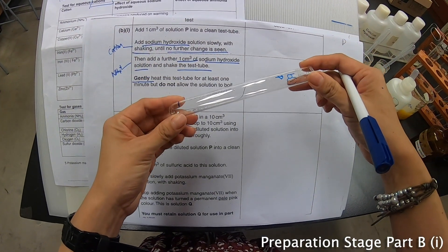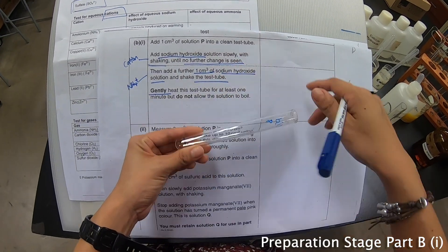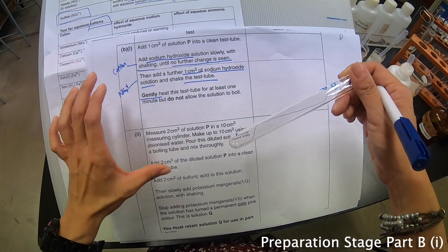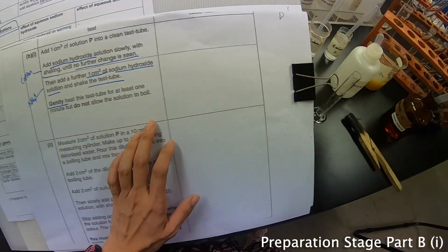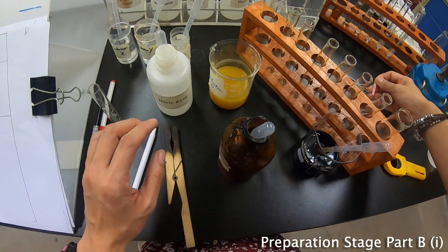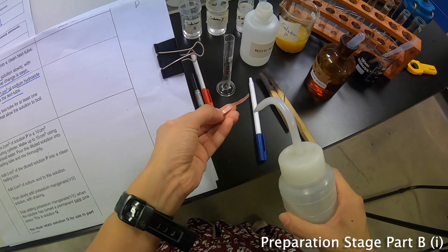So just now this is 1 cm³, then add sodium hydroxide, and another 1 cm³ again — you basically just keep on adding. What I would do right now is I will not do any more marking because these are just estimations. I'm going to make sure that I have my damp red litmus paper, and I'm going to damp it.